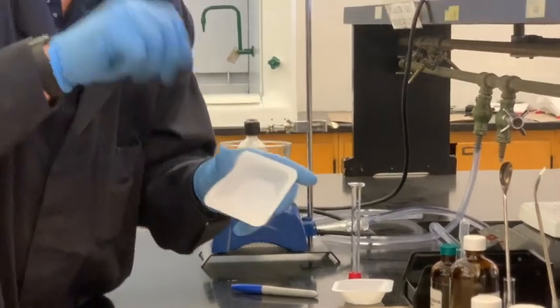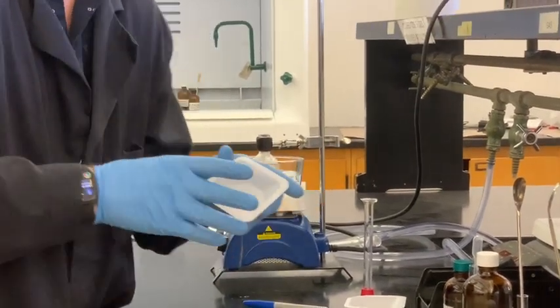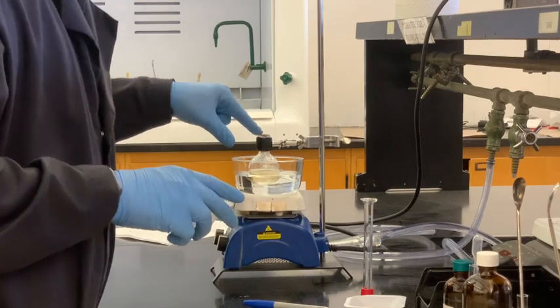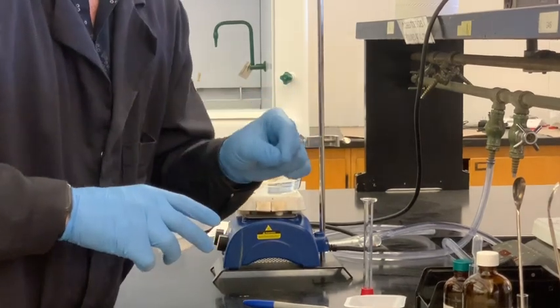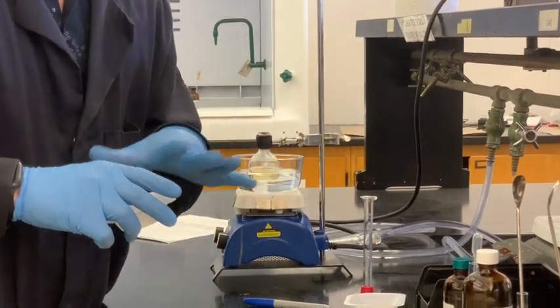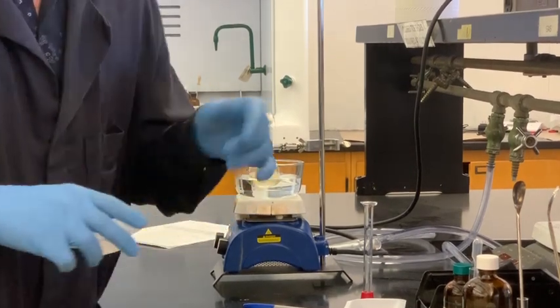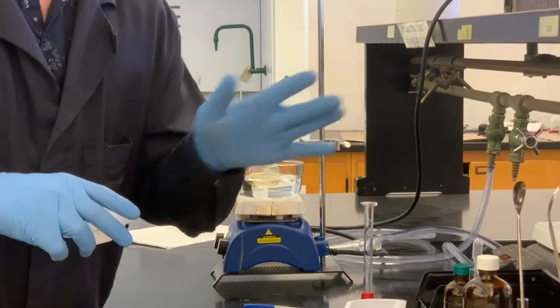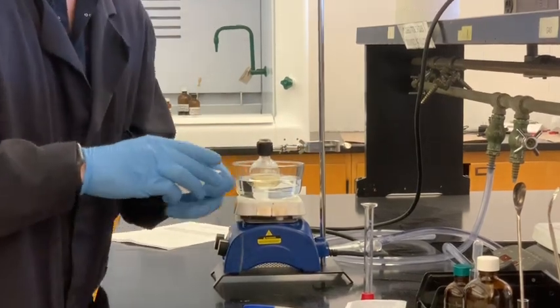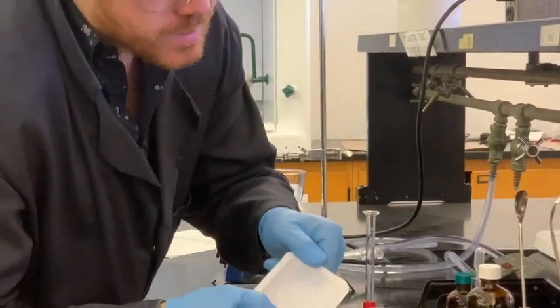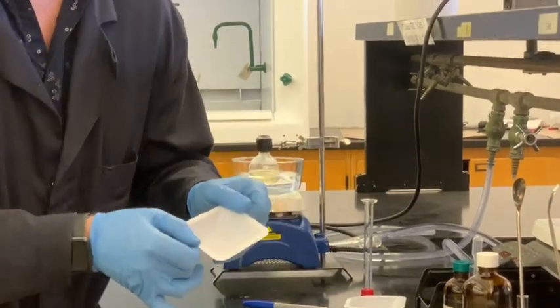And they should be easy to drop right in if you have pellets. If you have a lot of grease in the neck, it's going to actually get stuck, so you want to potentially rinse it down. Another reason why you don't want to add too much grease. You can always use a Kim Wipe to wipe it off. We have these four chunky little pellets and that's going to be easy to just drop right in.